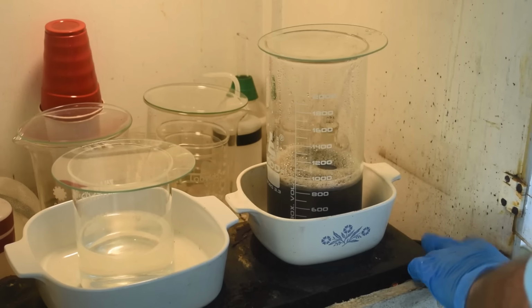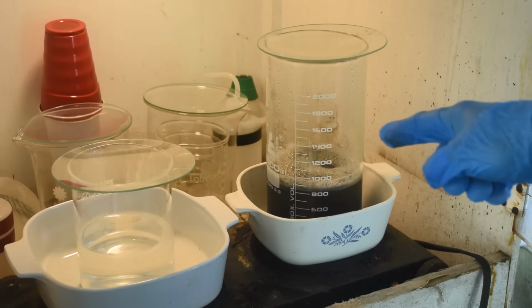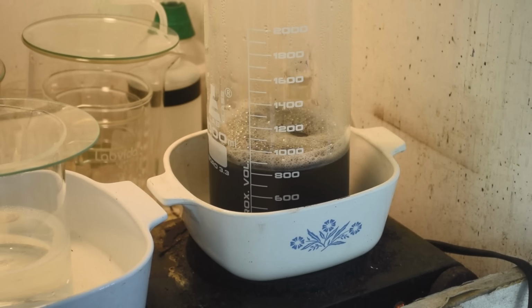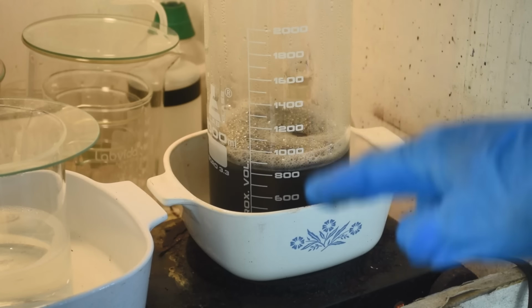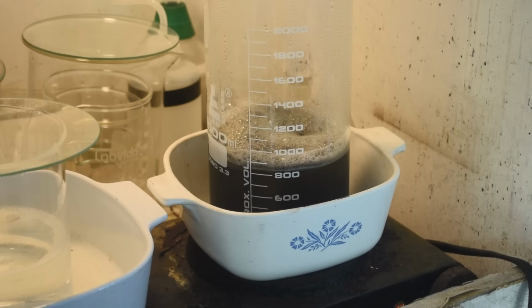We turn the heat up on this and get that boiling. Turn the heat down on that a little bit. It doesn't need to boil any harder. And we'll see what happens. She said we should boil this until the color goes away. If your palladium is fairly pure, you're going to wind up with palladium powder on the bottom of your beaker. If it's not pure, well, it'll probably stay in the water column as a very fine black powder. We'll see how pure the palladium is. So let me bring this up to a boil and we'll see what happens.